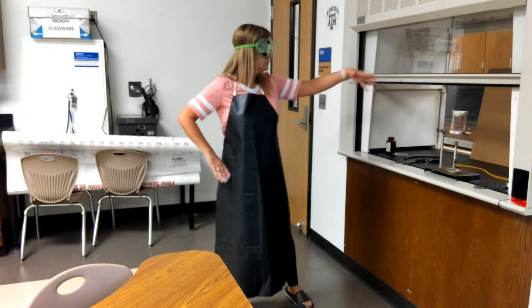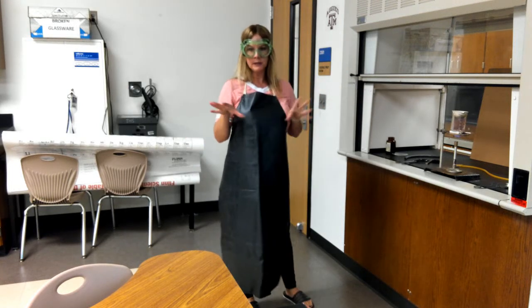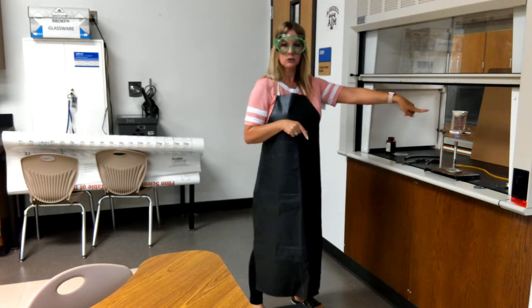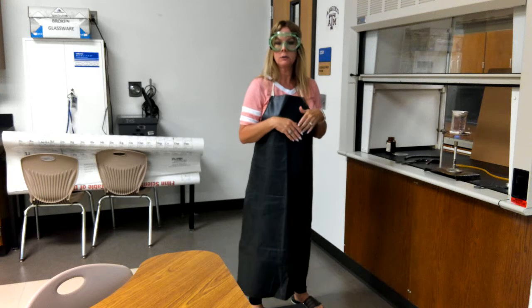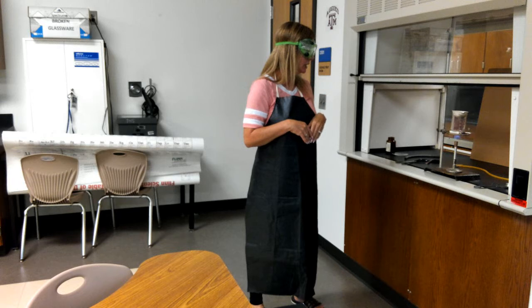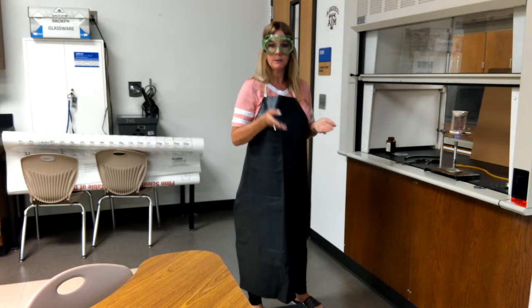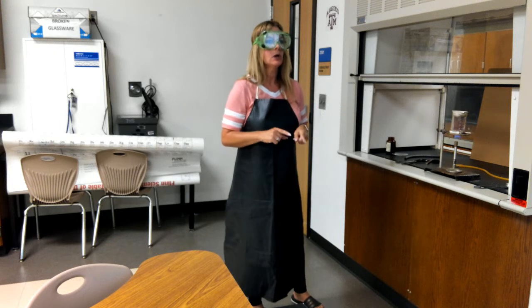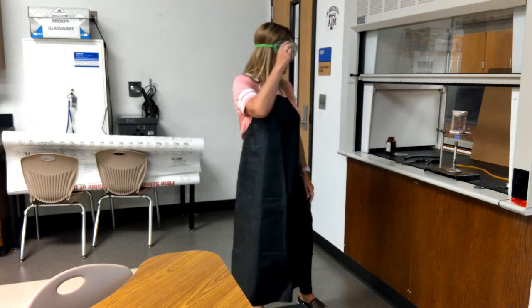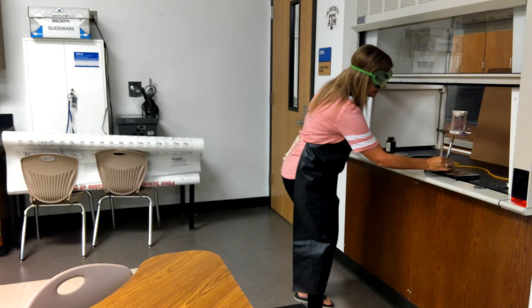Okay, and I'm continuing to heat it till all those purple vapors disappear because I don't want to breathe those. And think about what's going on. We're going from a solid straight to a gas. There was no liquid in there at all, right? We didn't see any liquid in there. It was just solid and vapors. And so I'm heating that solid till it goes all the way into the vapors. Think about what that's called when you go from solid straight to a gas. That's a vocabulary word you're going to need to know. And we're getting pretty close to all of it.